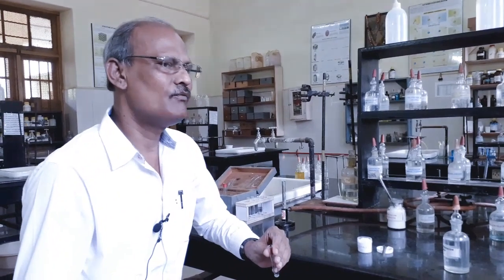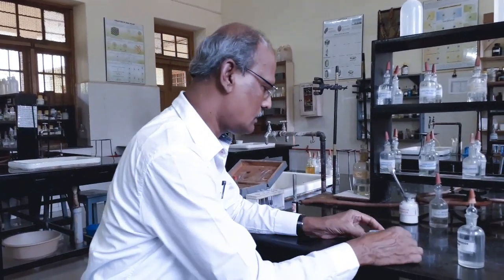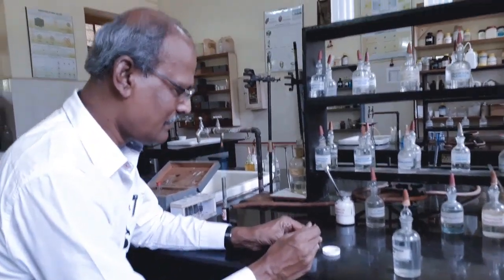To save some time, I just skip the analysis of first group and second group basic radical since it will not be given. We are not carrying out the test since they are excluded from the practical exam syllabus. Therefore, I am going to carry out directly the third group basic radical analysis.